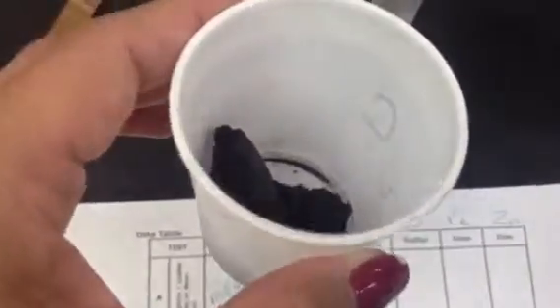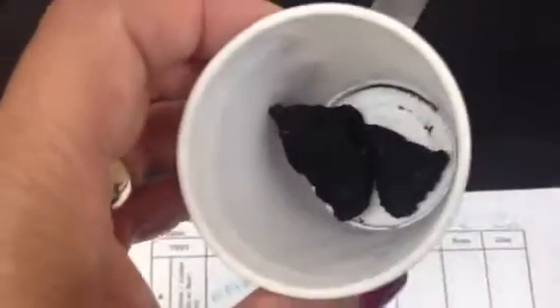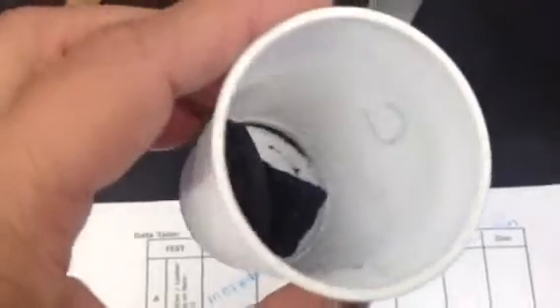We're going to go across on A and do luster for all of them before we go to the next test. This is carbon. Notice whether or not it reflects light, and write either metallic or non-metallic. For lead, let's look at lead, and notice that it reflects light. So write either metallic or non-metallic for lead.